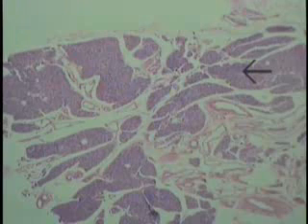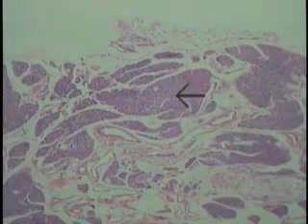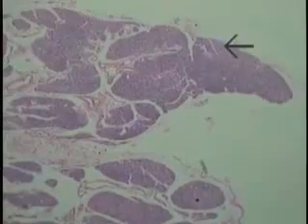This particular section is a low-powered view of the parathyroid gland. It has a thin capsule, and is made up of anastomosing cords or plates of cells without any apparent organized structure. Quite a bit of connective tissue subdivides the epithelial component of this gland. Even at this magnification, blood vessels of good caliber are visible — this is a very vascular structure, as one would anticipate for an endocrine gland, which of course lacks ducts.